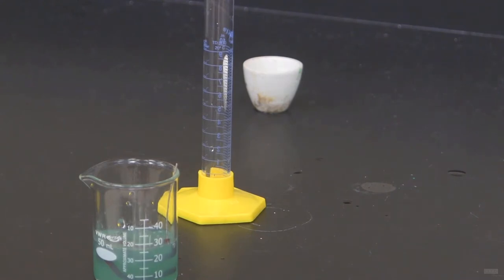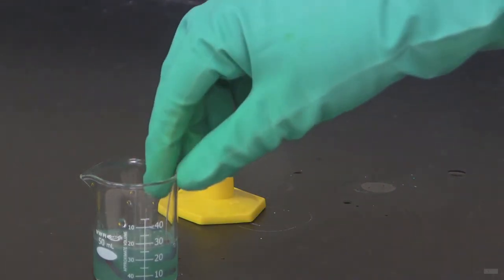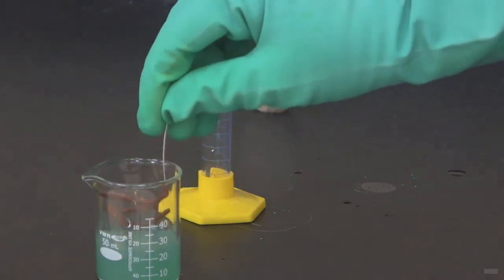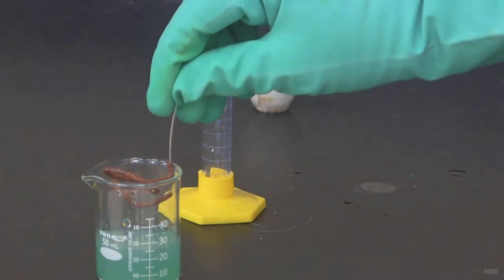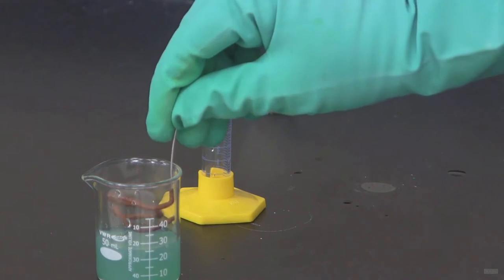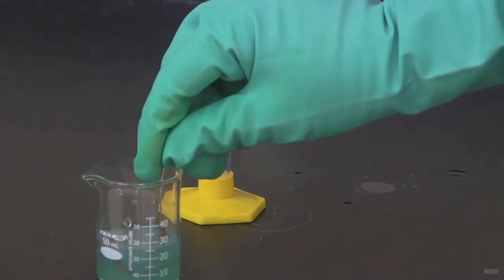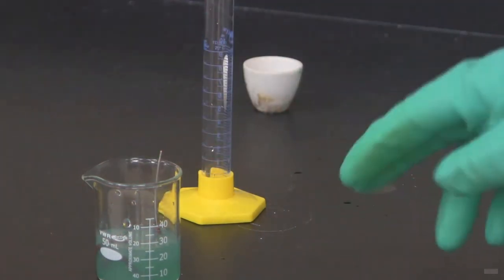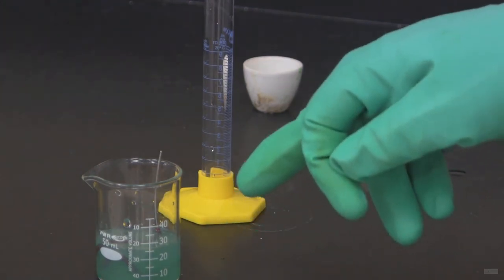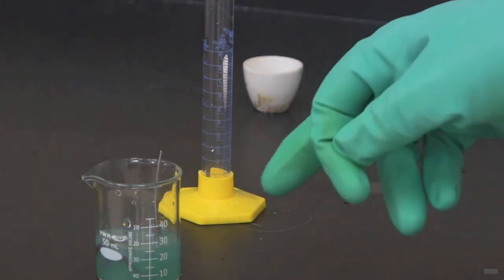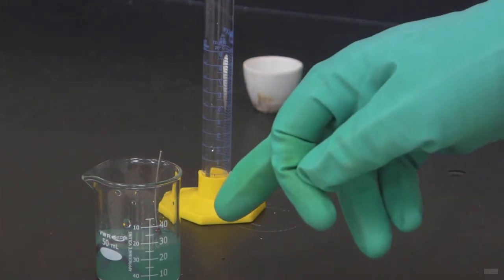So the solution has been sitting here for a few minutes. And what I want you to see is that we've got copper depositing on the aluminum that we put into the solution. Now it's still not done yet. It's still quite a colored solution. We're going to wait about 30 minutes total. And it will end up being hopefully colorless at the end.